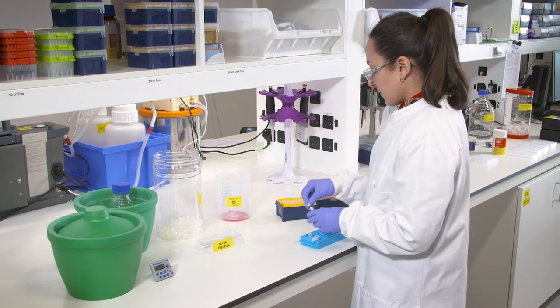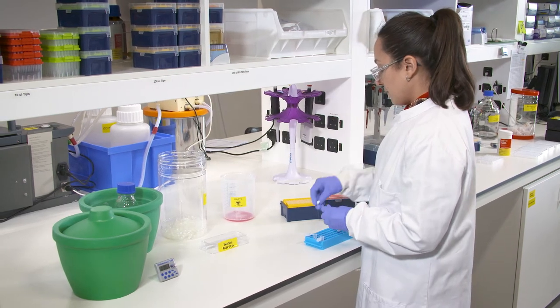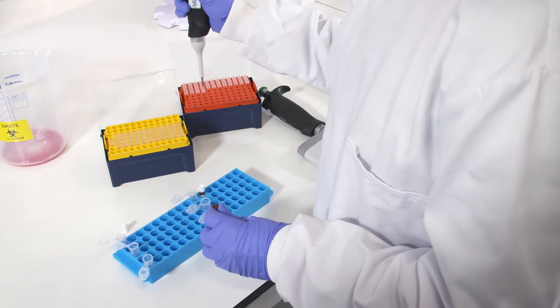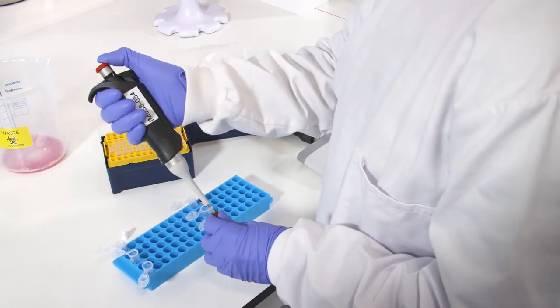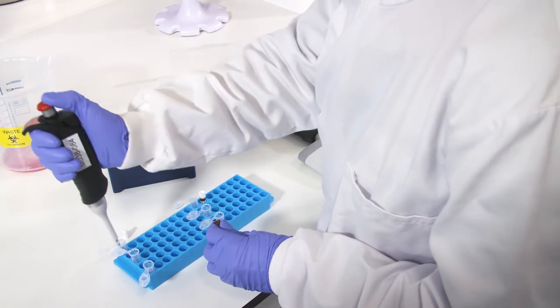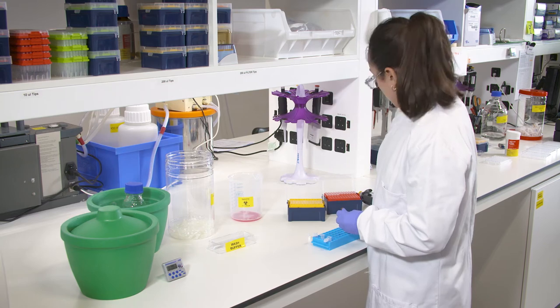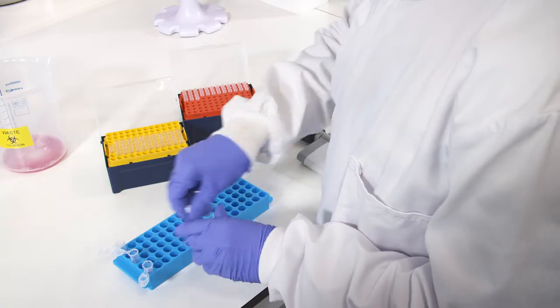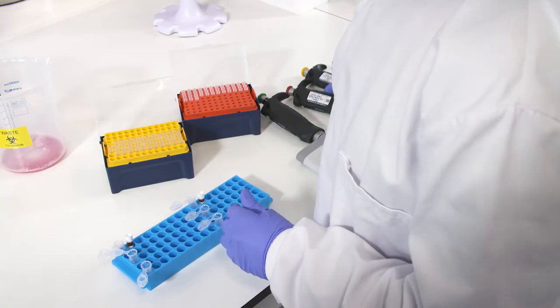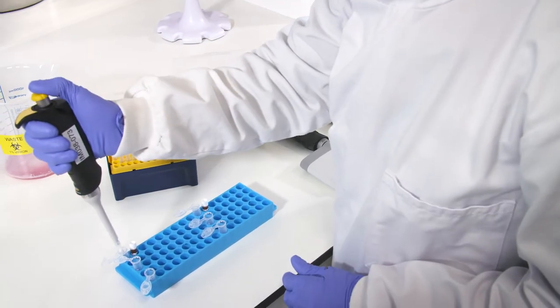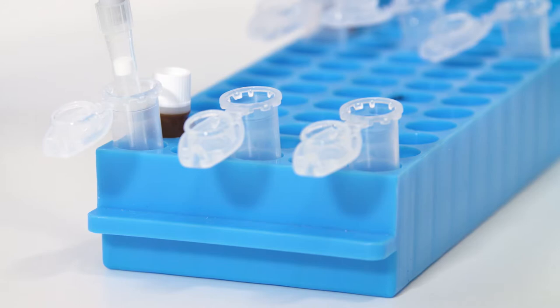If you are using an antibody for the first time, the working concentration should be determined via titration. Titration is important to avoid excess antibody which can result in the antibody binding to low affinity targets. This low affinity binding can increase background fluorescence. Use your antibody's ideal working concentration and dilute the primary antibody in wash buffer.